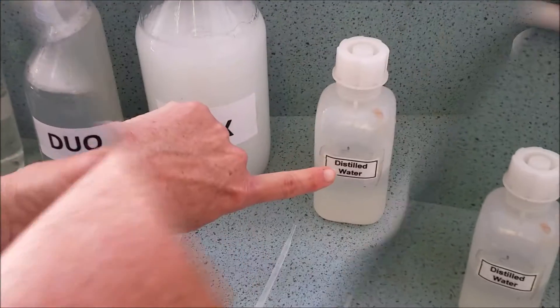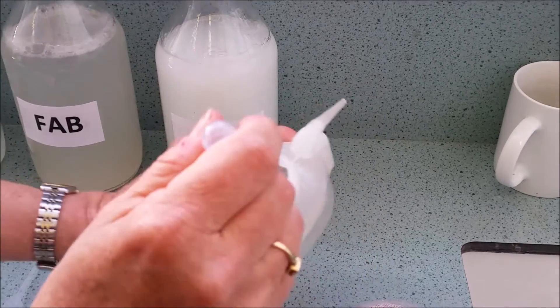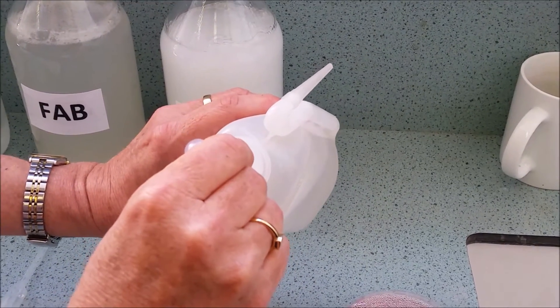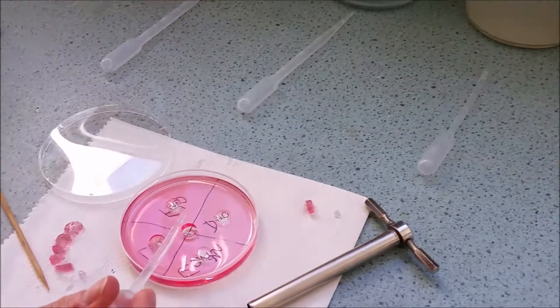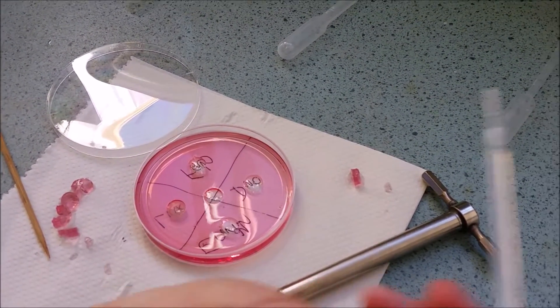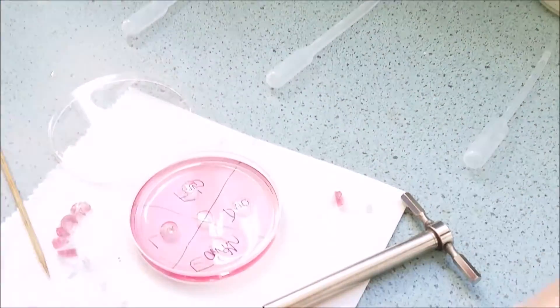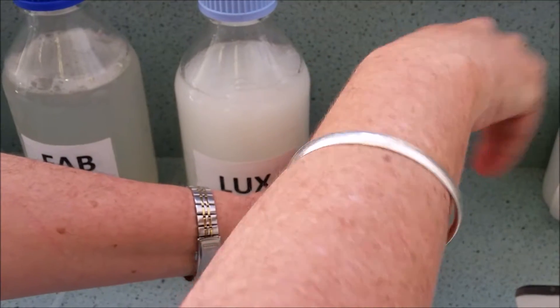Just repeating the process. I've also got distilled water. And you can have a think about why I'm adding distilled water into that middle hole. Now the lid's gone back on.